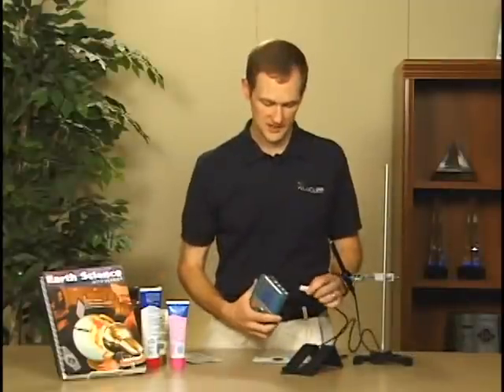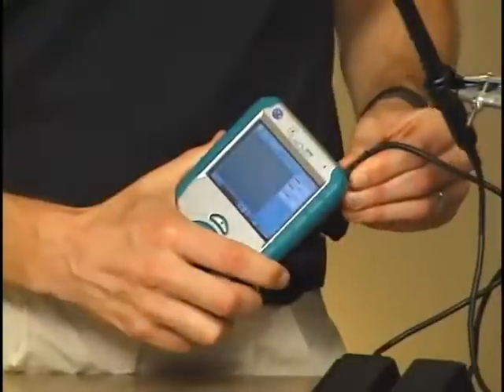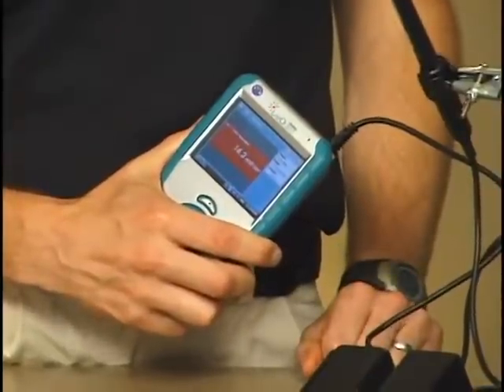Next, we connect the UV sensor into any of the four channels on the top of the LabQuest. It will automatically be identified, and we'll be ready to collect data.